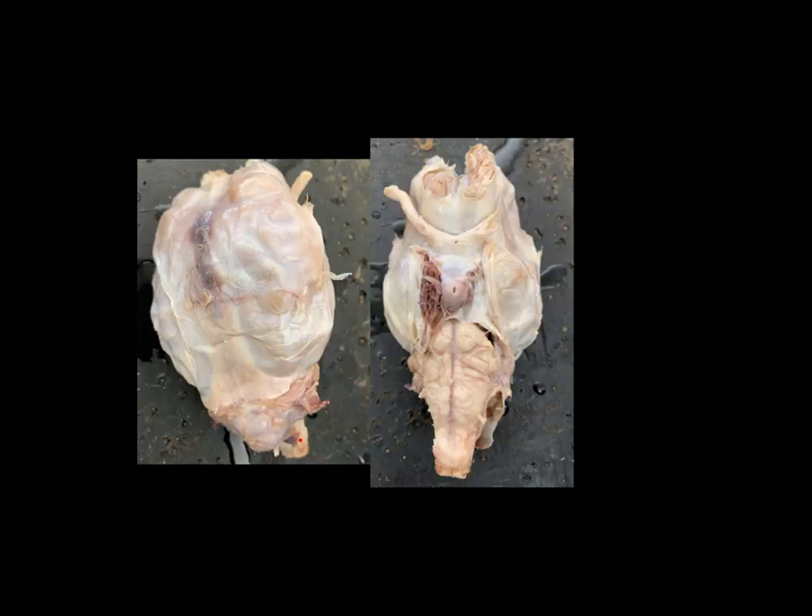We can see a little bit of the spinal cord down here, but it's not a very good image, so we'll see it shortly after we remove the meninges and flip the brain over or cut it open. Now on this side, we can see that dura mater and arachnoid mater covering the brain. Right here — this one has a hole in it because it looks like it's been poked with a needle — but this is the pituitary gland, which is briefly mentioned in Bio 137 but is really important when you get to Bio 139 in the endocrine system.